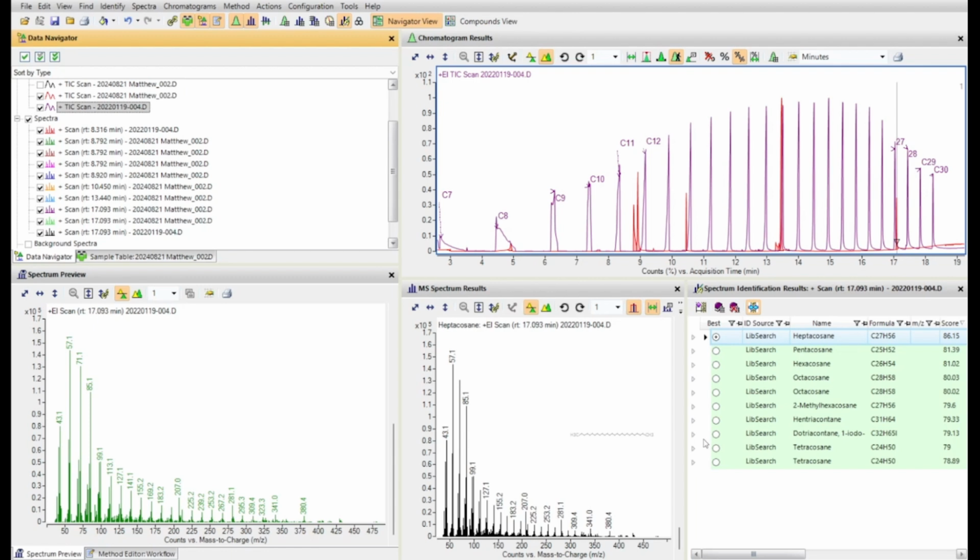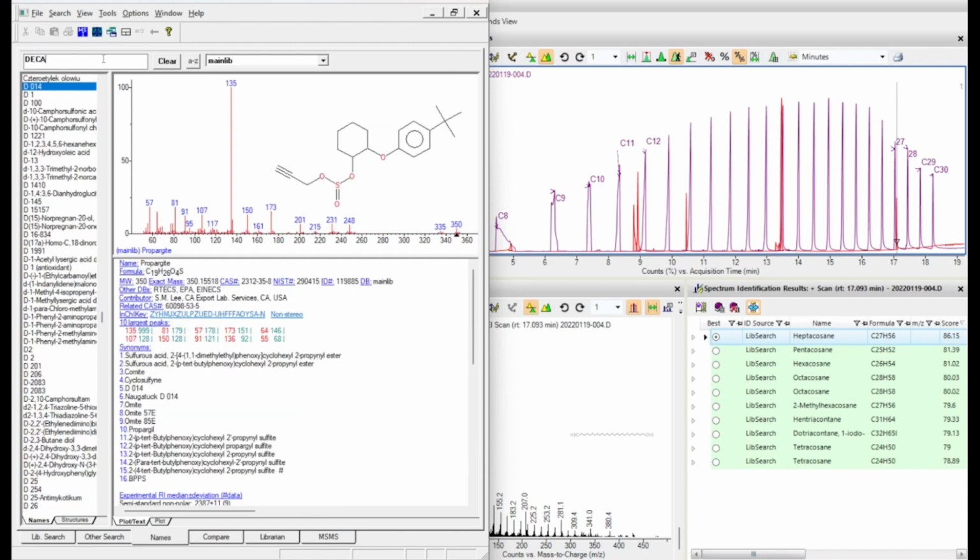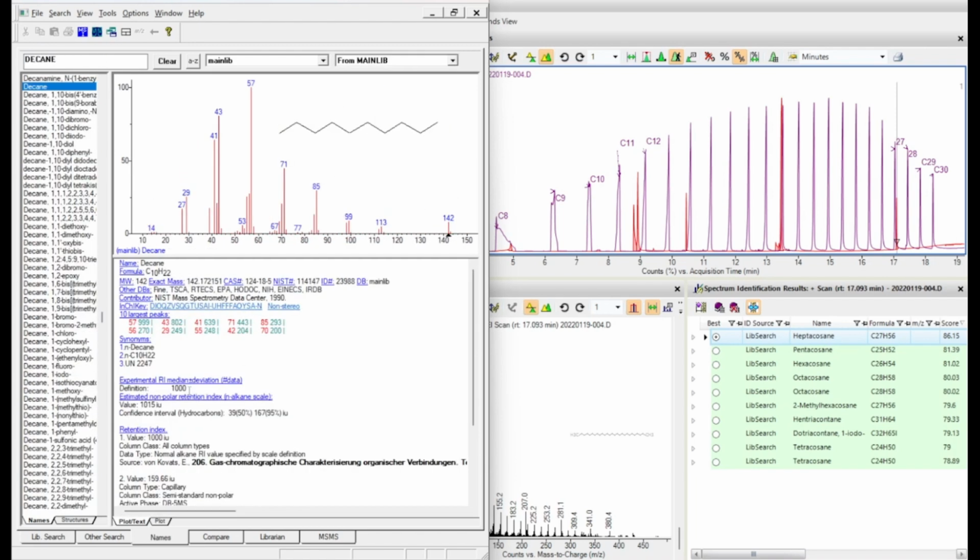In this example in purple, I've run a retention index standard that starts with C7 or heptane and ends at C30 triacontane. C10, for example, starting at C7, which would be 700, 800, 900, 1000, C10 or decane should be defined with a retention index of 1000 because it has 10 carbons.